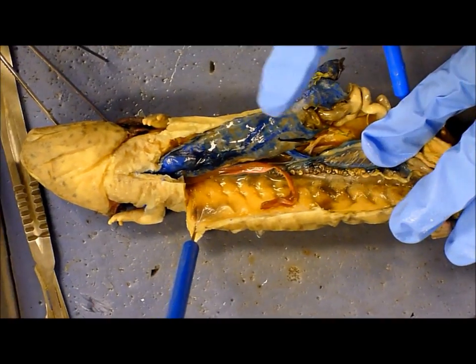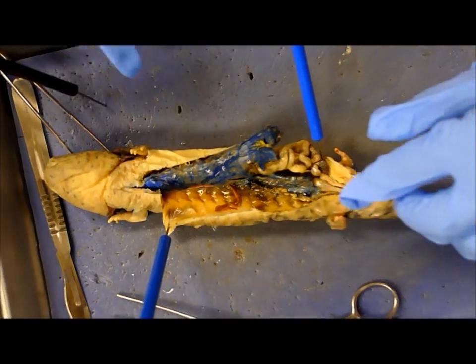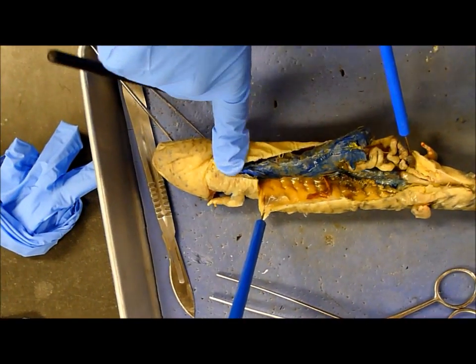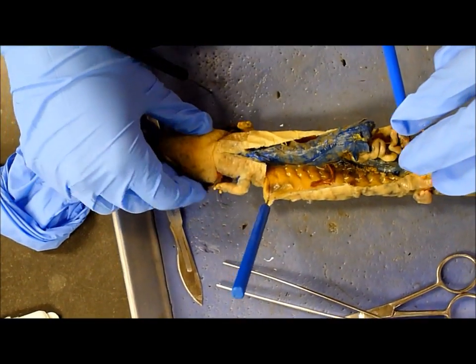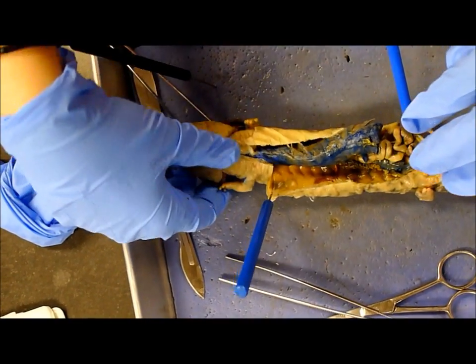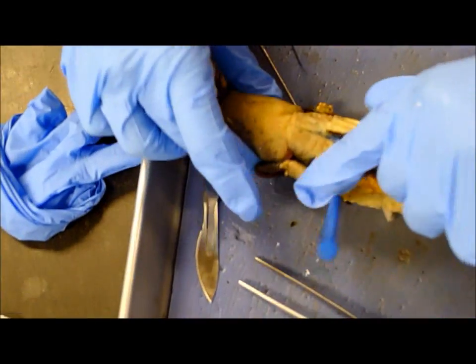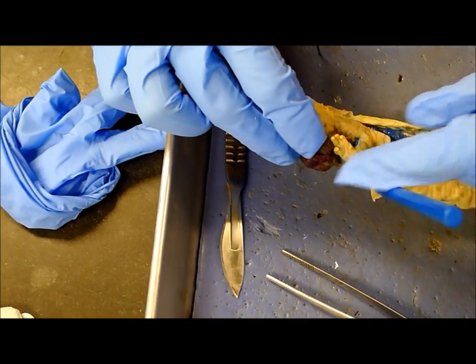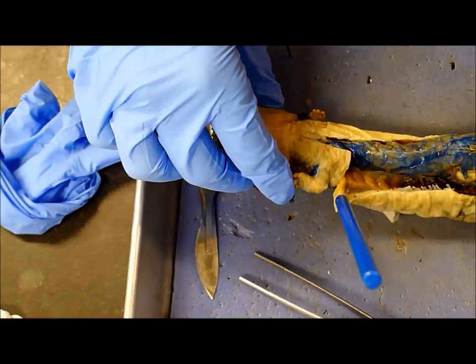The pericardial cavity is up here, which we haven't gotten into. The external gills are these guys right here. And that's about all we have.